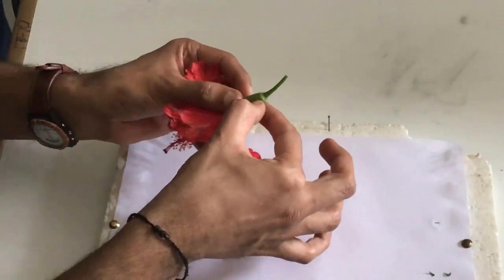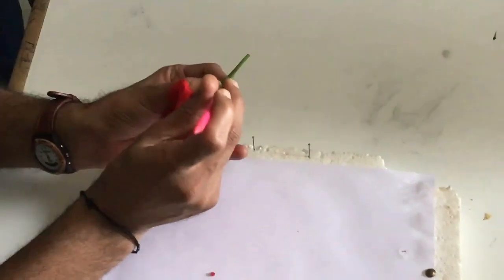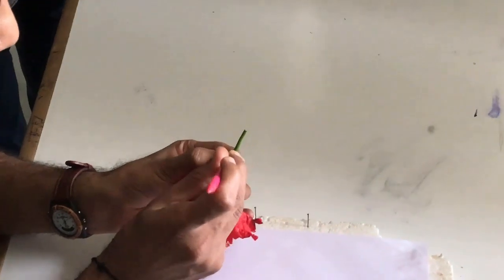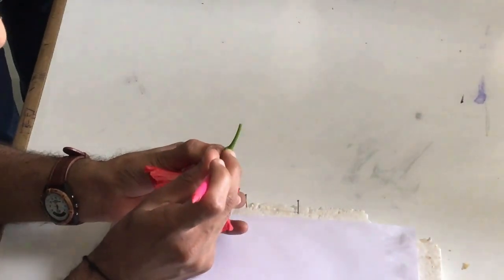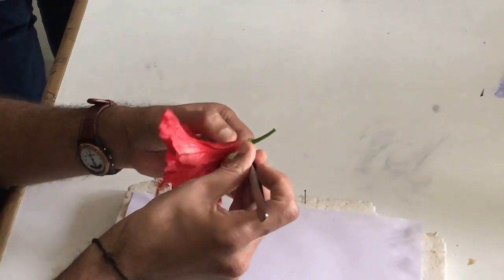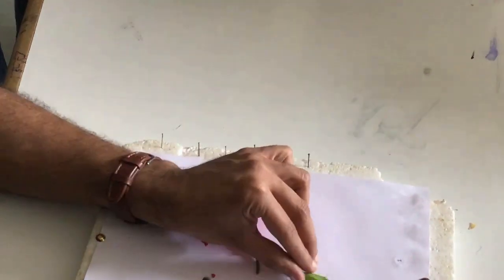Most people pluck it by hand, but we should use the forceps and go very slow. Put an incision and work carefully. Once the incisions are made it becomes easy to remove the calyx. You can see it is all fused together — that confirms it is gamosepalous. I will keep it and pin it.